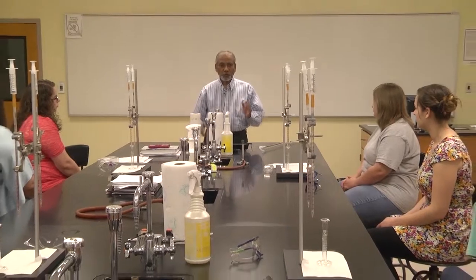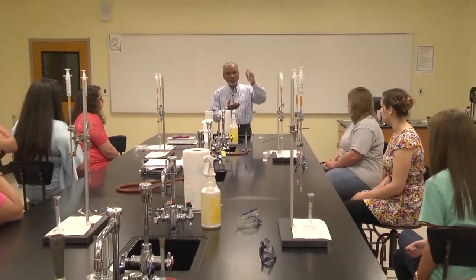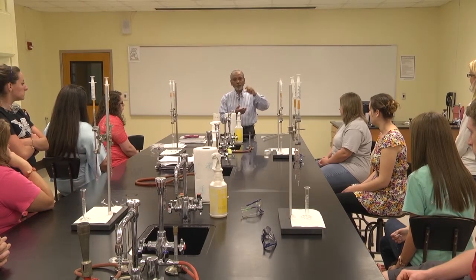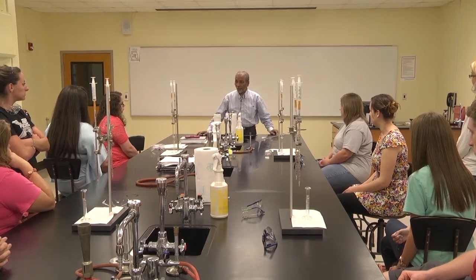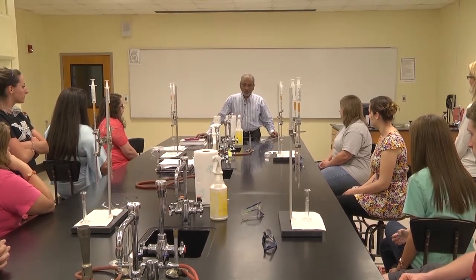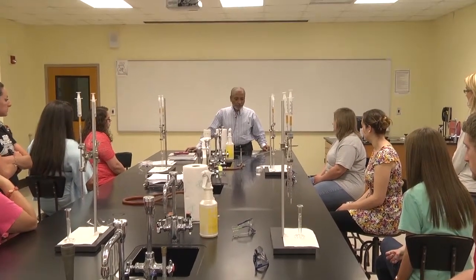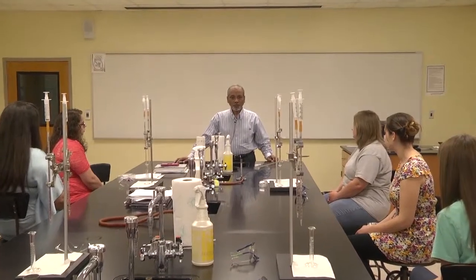In the class you have learned acid-base reaction, right? What happens when acid reacts with the base? It forms salt and water, right? So in this reaction, you are titrating vinegar with sodium hydroxide. So sodium hydroxide is going to react with acetic acid, and it will form a salt. So what is the salt going to be? Sodium acetate. Very good. Sodium acetate and water also will be formed.